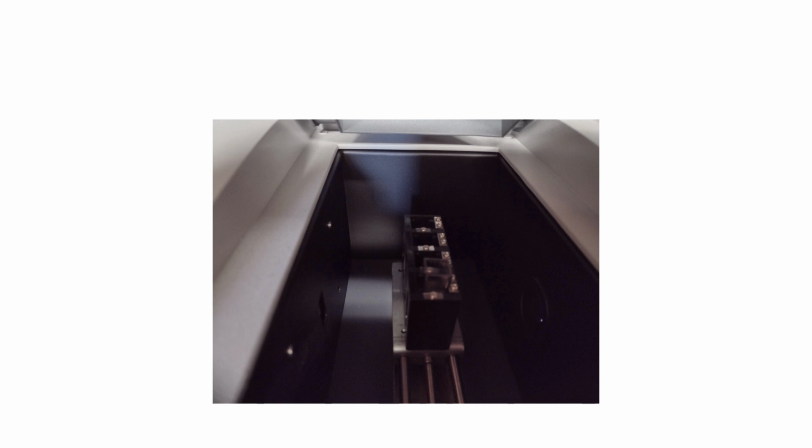But once you've set up this correlation, okay, I know if I get a reading of 0.375, I can plug that in and calculate how many bacteria I have. Once that's done, then it's very easy. You just put the sample in, you close the lid, bingo, there's your number. Next sample in, close the lid. This lid closes this down, so you always close it before you take the reading. And it's literally that fast.